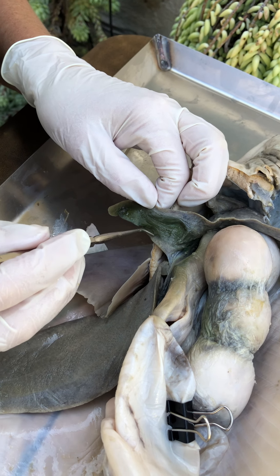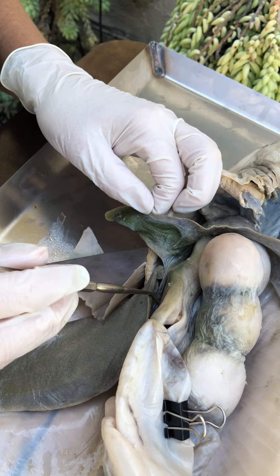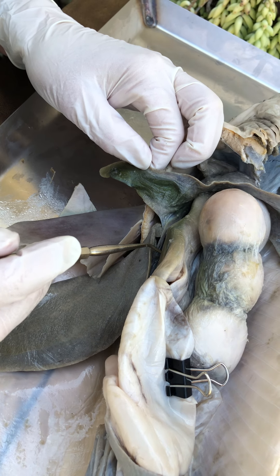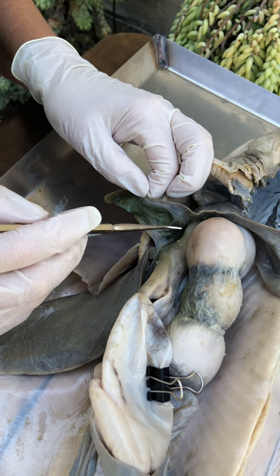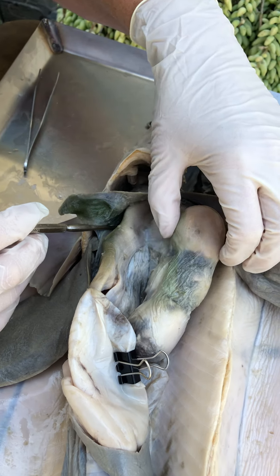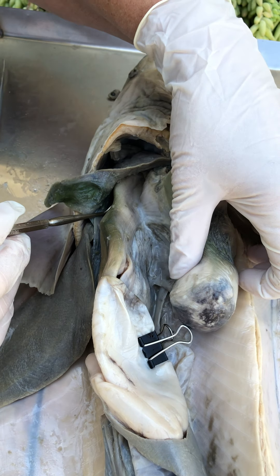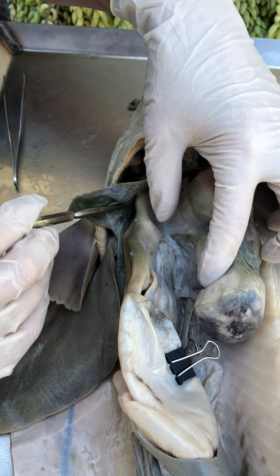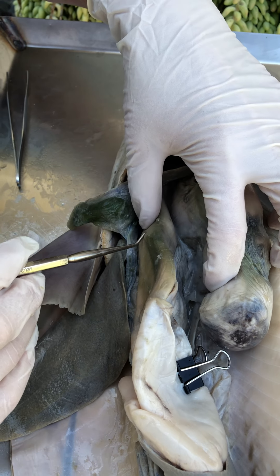The gallbladder is an accessory organ that's going to drain into the duodenum, but we're not there yet in the alimentary canal. Let's pick up where we left off in the canal. We'll move the ovary over — here we are at the esophagus.